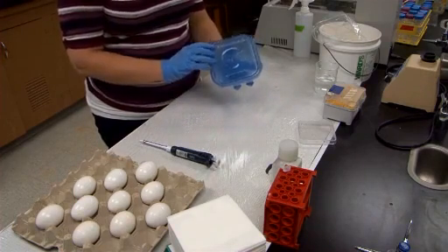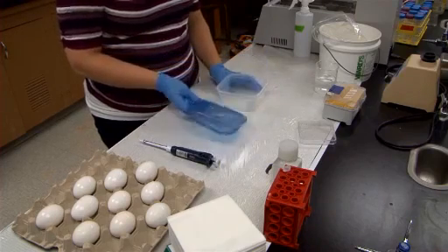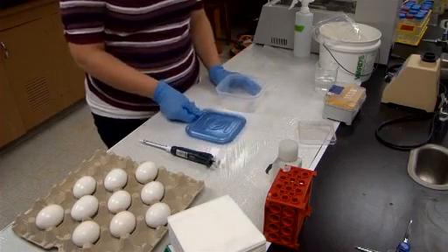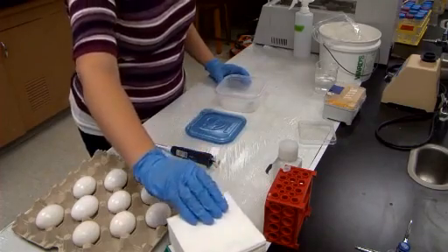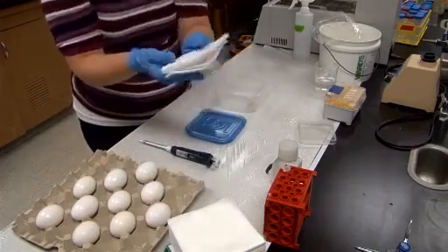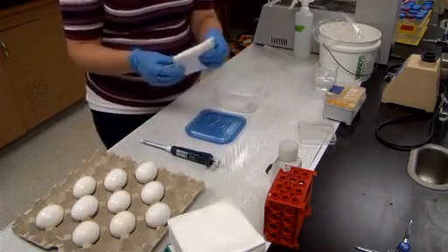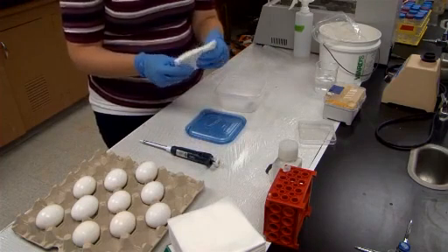The humidity chamber is made out of a Ziploc container. The first step in building the humidity chamber is to add a 1-2 cm layer of absorbent padding, in this case kimwipe, although layers of cotton padding can be used as well. This layer of absorbent padding fits into the base of the Ziploc container.